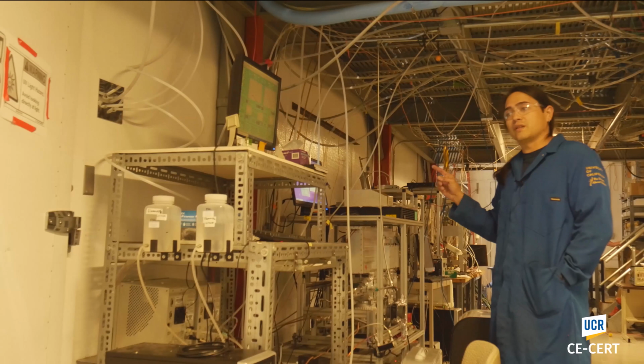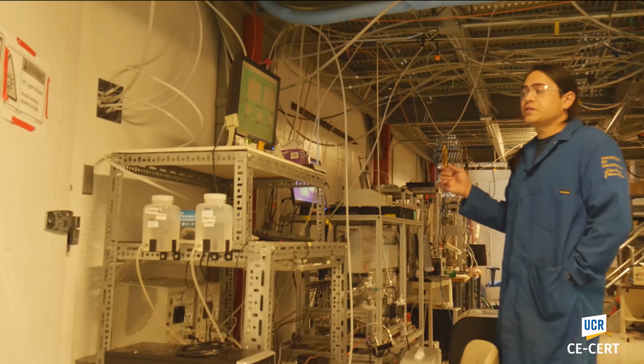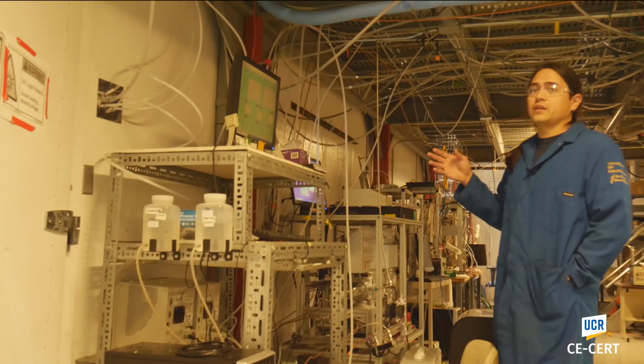So this is a mass spectrometer specifically designed for aerosols. And essentially it allows us to determine the chemical composition of the aerosols that we're analyzing in our particulate stream by determining what the m/z ratio of different ions of those chemicals is. So what we do is break apart the particles that come in our polluted stream and then use time of flight and then mass spectroscopy to determine what those particles are comprised of.